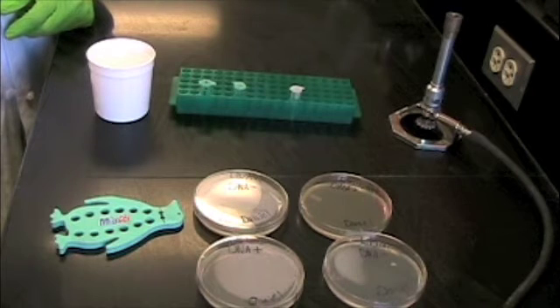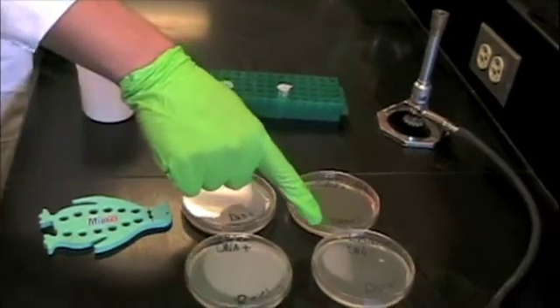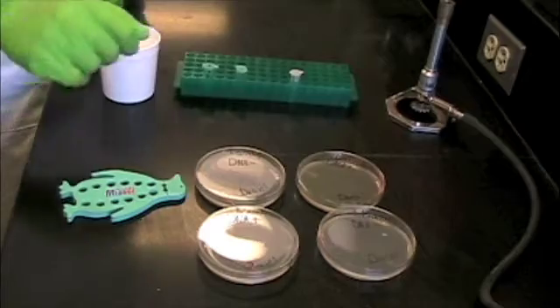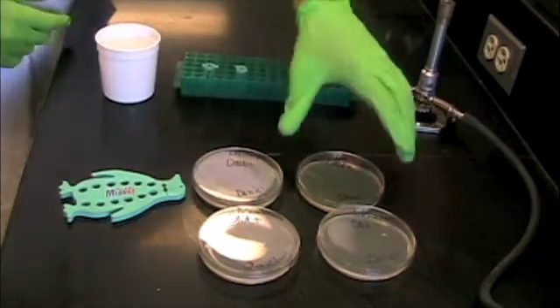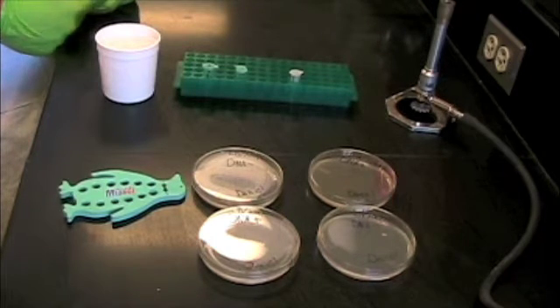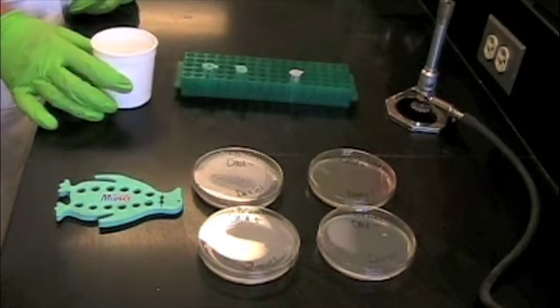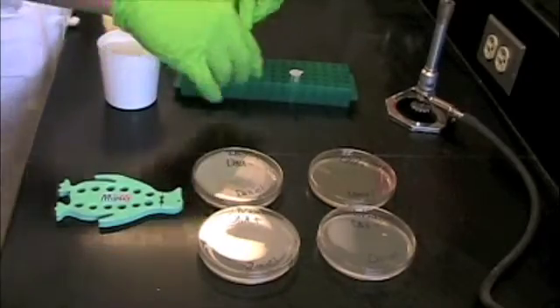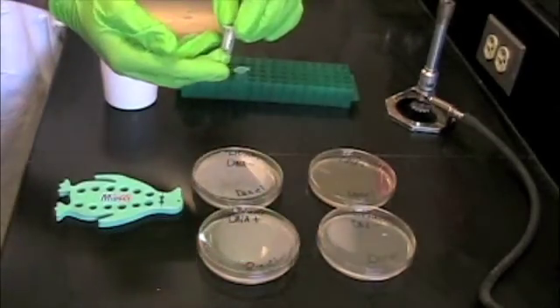We are now ready to conduct the experiment. You will need to collect several supplies. First, label one LB agar plate DNA negative. Next, label one LB ampicillin plate DNA plus and one DNA negative. The last plate is an LB arabinose and ampicillin plate, labeled DNA plus. You will also need a foam microtube holder, a plastic cup full of ice, two microtubes labeled DNA plus and DNA negative, and a solution of calcium chloride. Of course, it's always nice to have a smart lab partner.